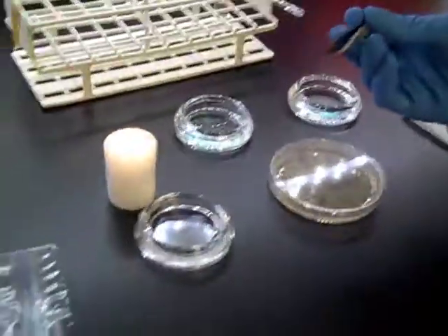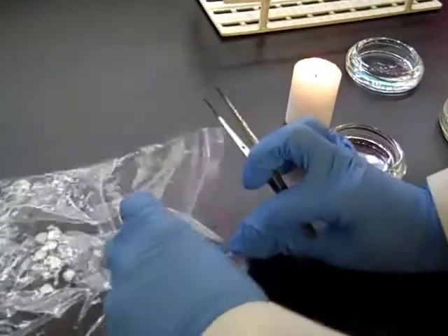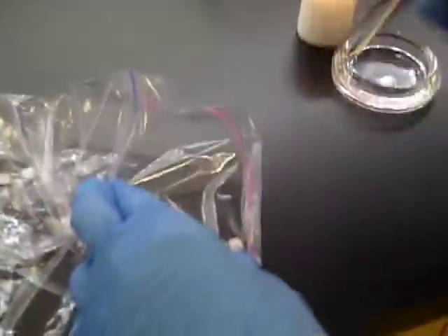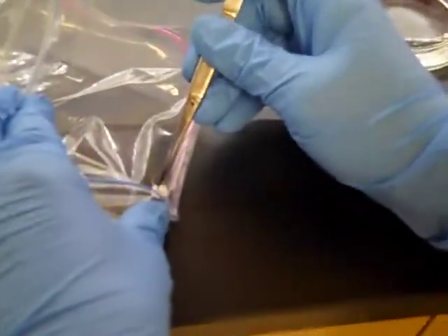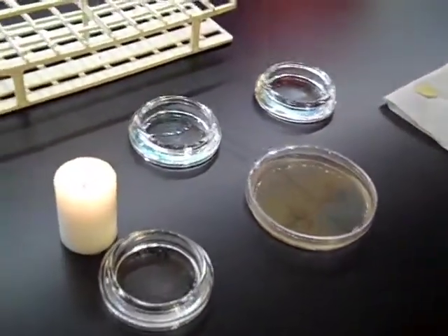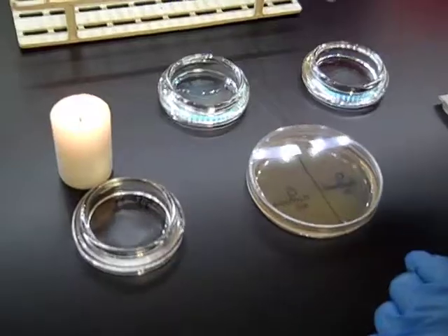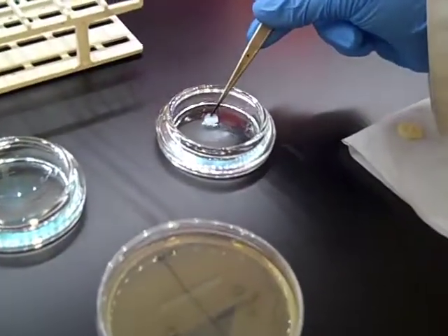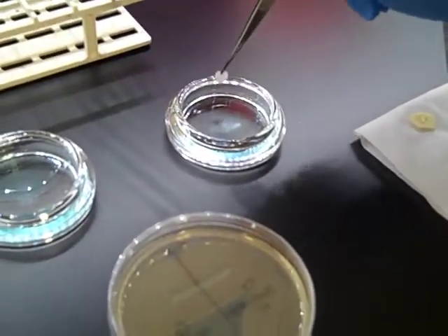Then you're going to go to your bag of filter paper discs. Open the bag, and then aseptically grab a filter paper disc out. In this instance, we have our two mouthwashes here. Mouthwash number one, I'm going to dip the filter paper disc in the mouthwash.